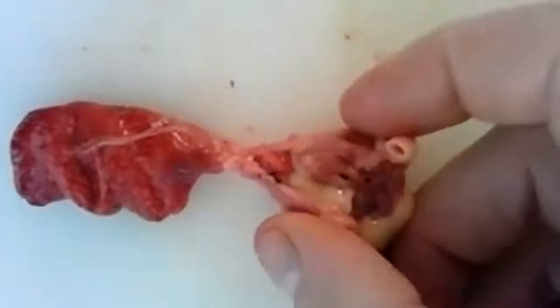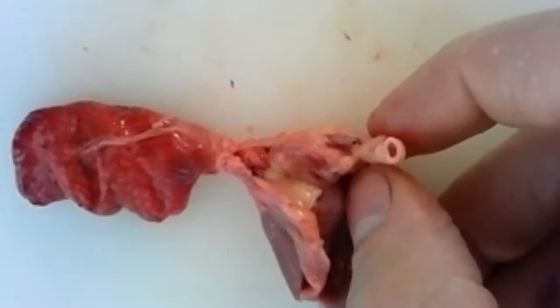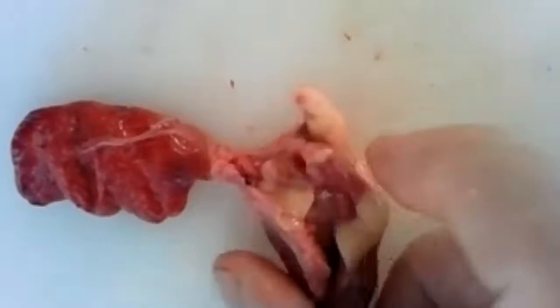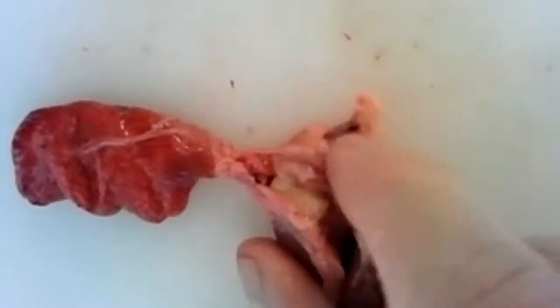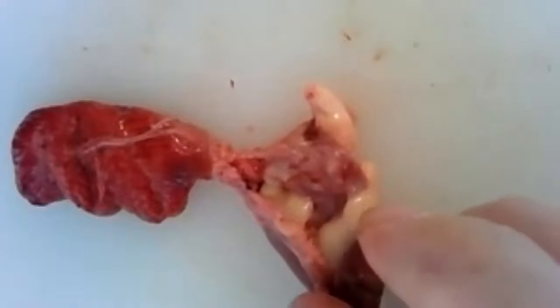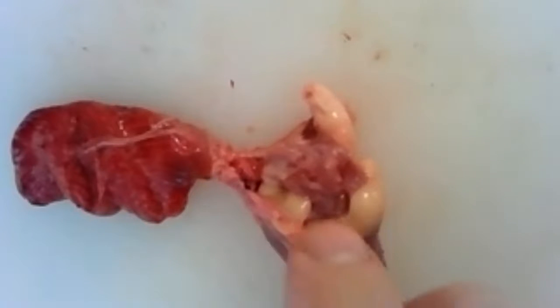So speaking of those tubes, this is the biggest one. And this little guy, how cool is that? We can actually see the tube. Oh my goodness, how cool. See right down in that tube. So that little tube, guys, that is connecting down here in the heart. And there's only one thing that could be, since it's the largest tube coming off of the heart, that must be the aorta. Okay, so that aorta is what feeds most of the body with blood that gets pushed through the heart.